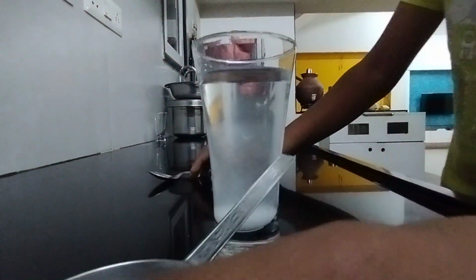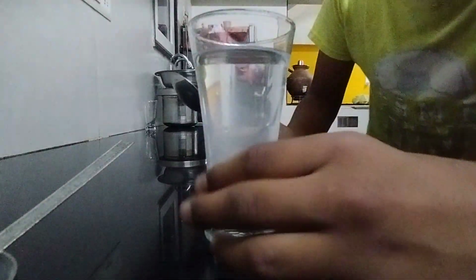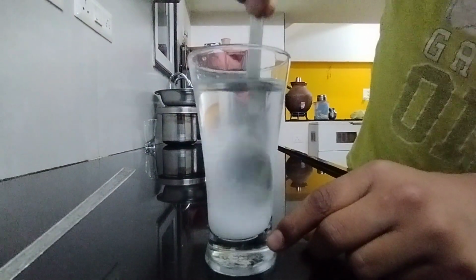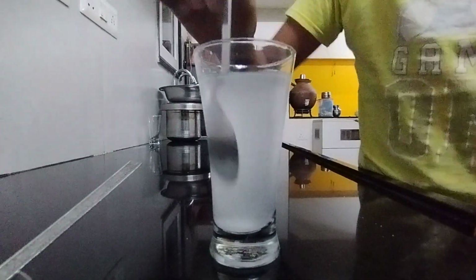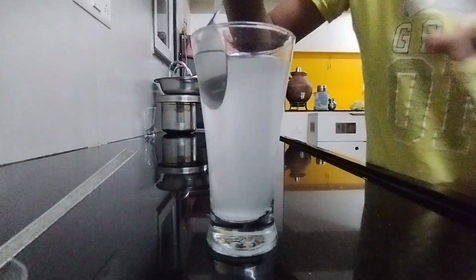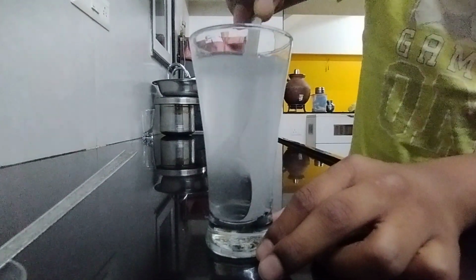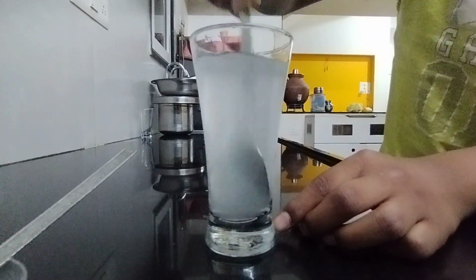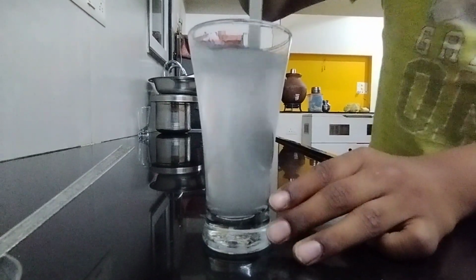So I added it, and you can currently see that the size, the shape and the color of the water is being changed. If you can see, the shape also changed somewhat. It has some mass. When it is clear water, it has no mass. When we add some substances, it has some mass or weight. So I am stirring. You can see the color of the water has been changed and nothing is appearing, or we can see inside what is happening, but I am saying still the salt is not dissolved, and now it is dissolving.